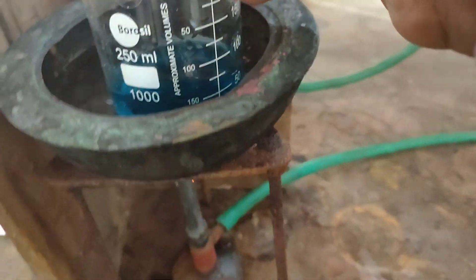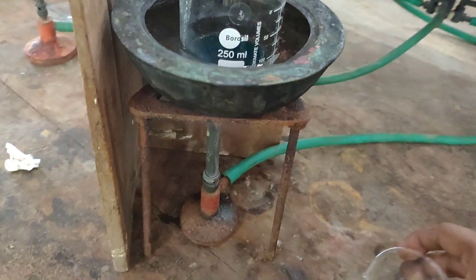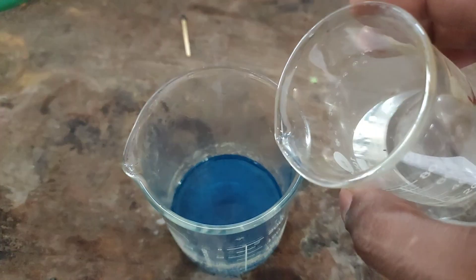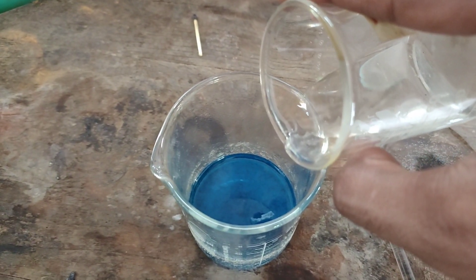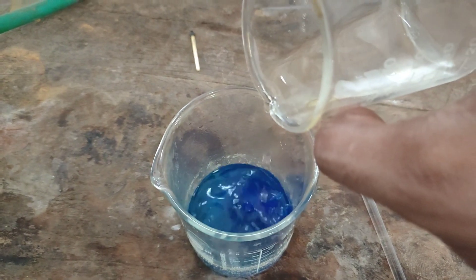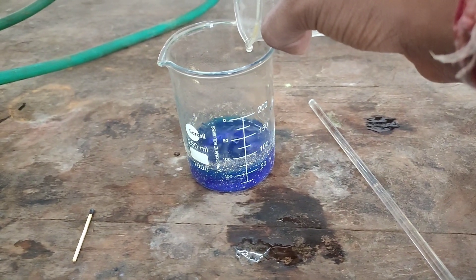The copper acetate solution was heated in a water bath so that all the copper acetate would dissolve. While the copper acetate dissolved, both solutions were mixed under hot conditions. The glycine solution was added slowly in small proportions to the copper acetate solution.